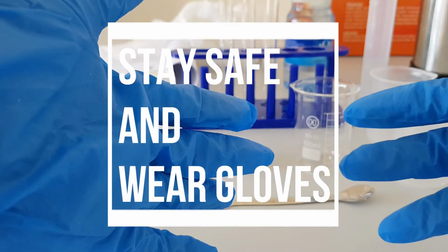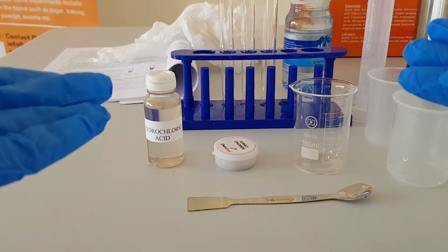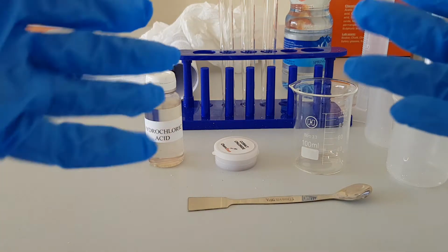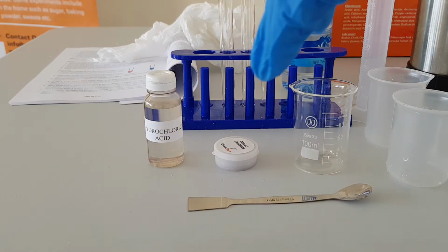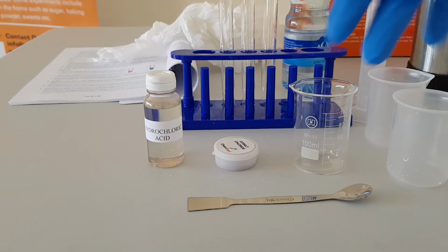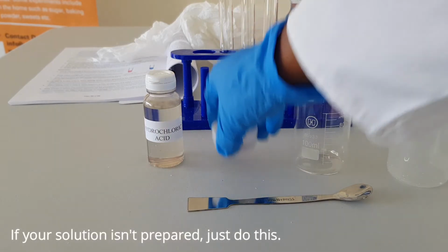You also have to wear gloves because you're going to be handling hydrochloric acid, and hydrochloric acid is corrosive, so you need to be safe, and you'd be wearing your safety glasses by this time. If your kit comes with a cobalt chloride solution that is already prepared, then you're literally set to go. But if the cobalt chloride solution has not been prepared, you'll prepare it this way.